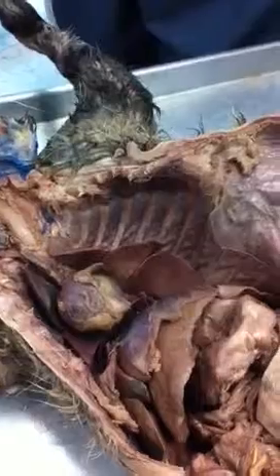All right. So I'm going to turn this around so the other guys can see that. Okay. Come back. Yep. Thank you, Miss Shelby. All right. You guys see this line right here? This opaque line that's running down and innervating the diaphragm? Everybody see it? Okay, let me back out so Andrea can see. Andrea, you see it here? Oh, yeah. Okay, that's the phrenic nerve that innervates the diaphragm.